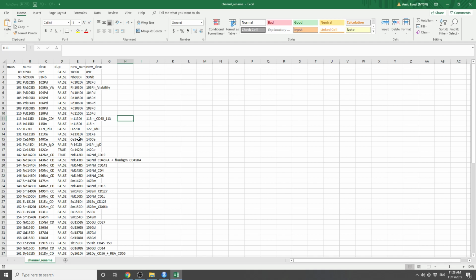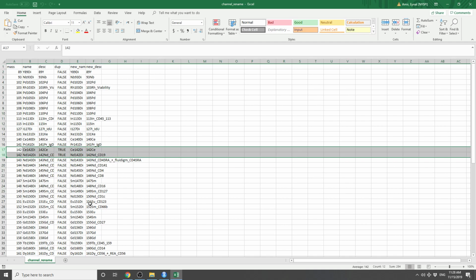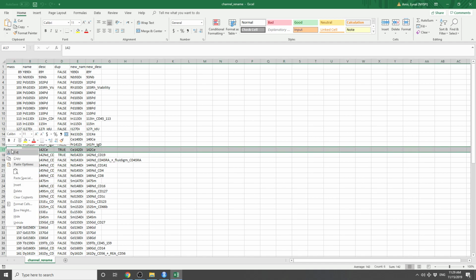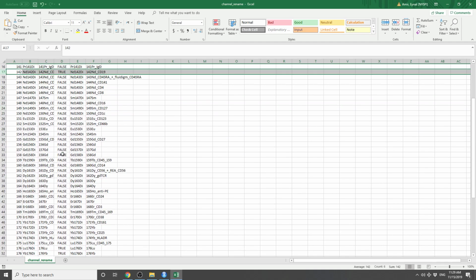And cytutils was designed for the CyTOF. So the way this table is organized is by mass. And you will notice, for example, that these files have two channels with the 142 mass, and cytutils is highlighting it using a column called dupe. So if dupe is true, it means that a certain mass has two channels to it. In this case, this is not an issue since only one of these masses has any data in it, which is ND142 that has CD19. So I'm actually going to delete this row so that the dupe is going to be gone.